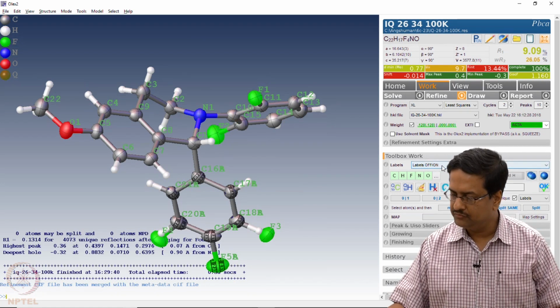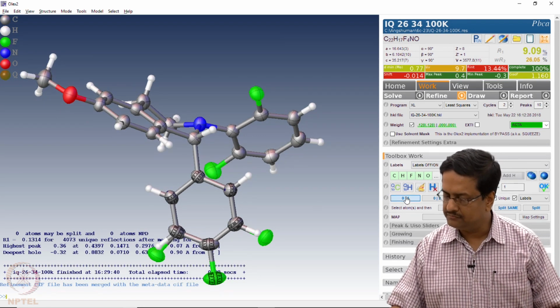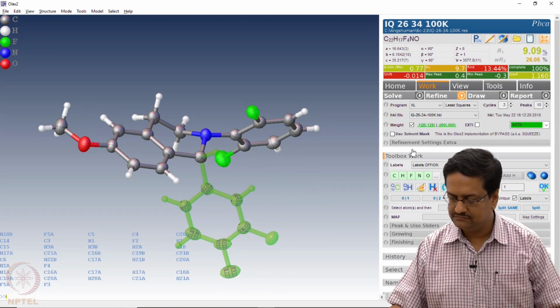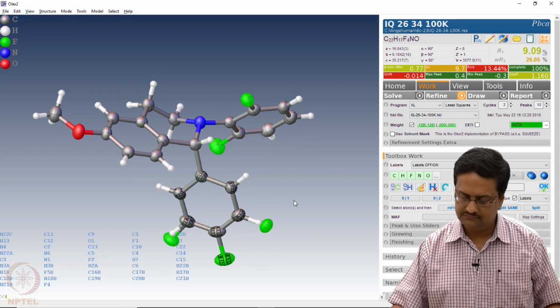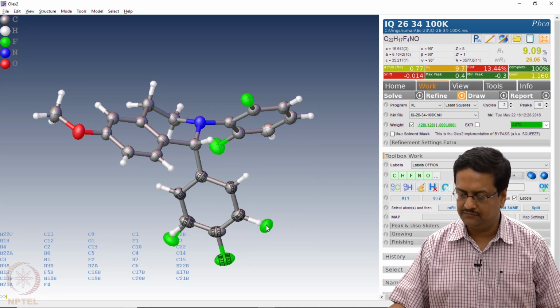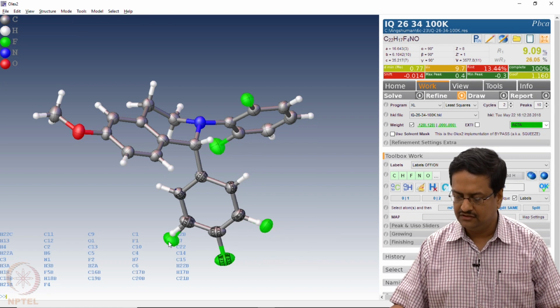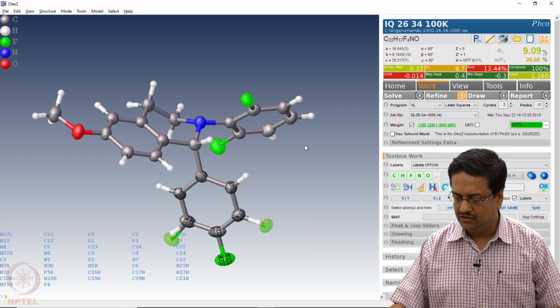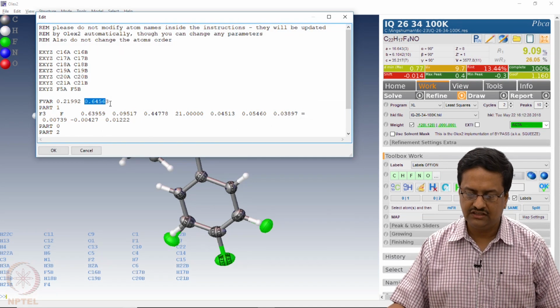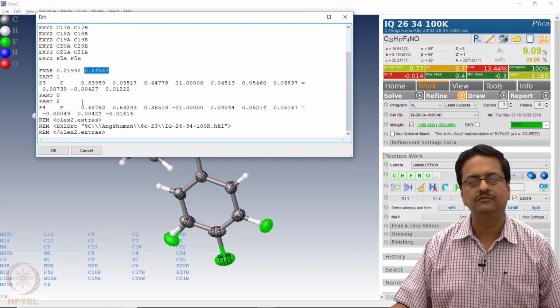Now look at the part of the molecule here which is now disorder treated. We have part 1 which looks like that, part 2 which looks like this. So all the parts, if we show, it looks like that, which means this particular fluorine is on the right hand side and has occupancy of 64% and this has occupancy of about 35%. If we just take those two atoms and try to see, what we see is 0.64. So 0.64 is for plus 21, which is F3, and the other one is minus 21. So that is 1 minus 0.64, about 0.36.